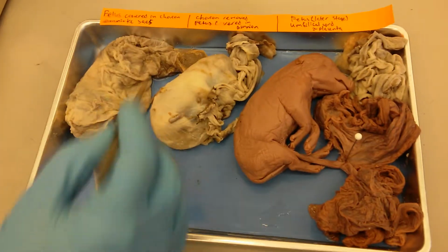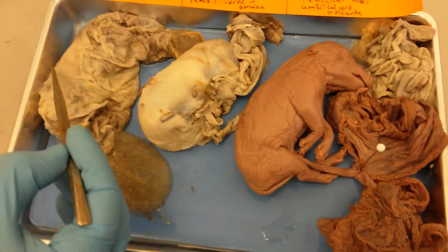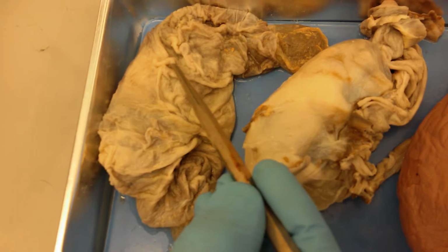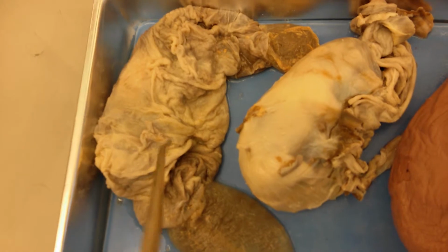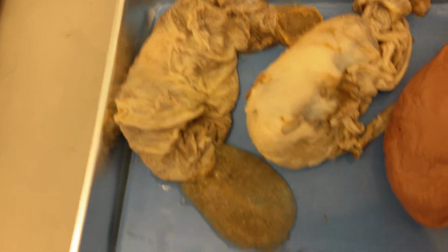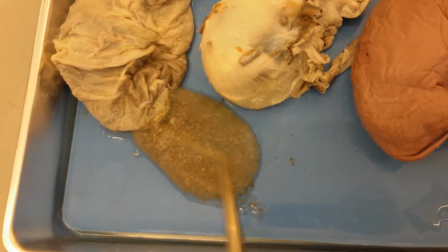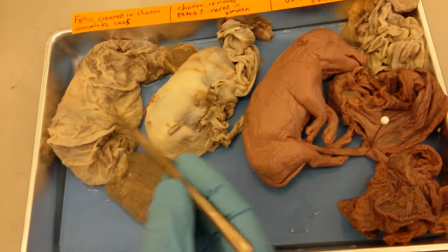Now, moving on here, we actually have these fetuses that were removed from the uterus that you just saw. And so this fetus here is covered in both chorion and amnion, the two coverings that surround the fetus. And here we see the chorion as the outside protective layer, and then these are actually amniotic sacs currently containing the amniotic fluid, which is going to be surrounding this fetus during pregnancy.